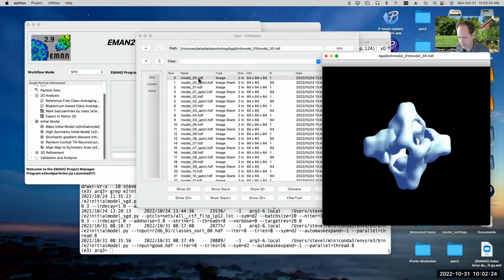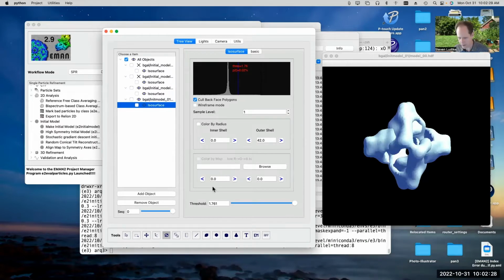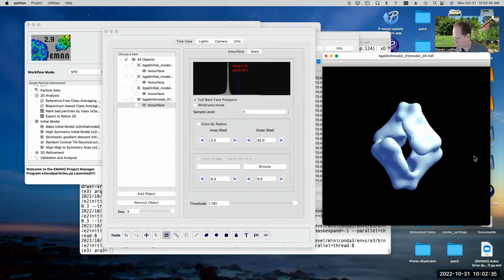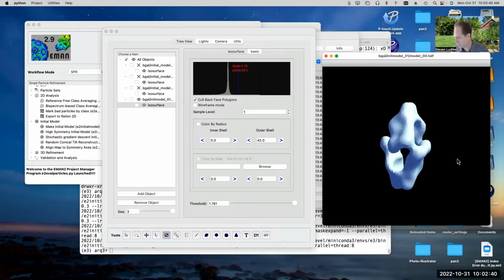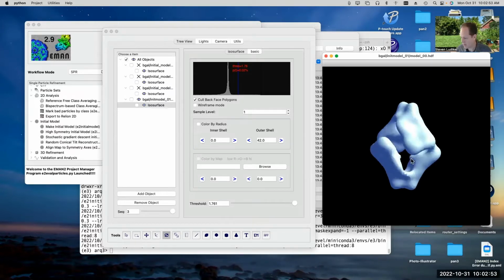And if we look at the 3D map here, sorry, this is an overlap again. I'm just adding more 3D maps to this window as we go. So here's the 3D map that we got out from the initial model generator using all the particles as raw data. And you can see, it's not too bad. It's maybe a little bit wider than it should be, but it's almost certainly fine for purposes of refinement. It has all the features that it needs to have, and this is pretty typical.